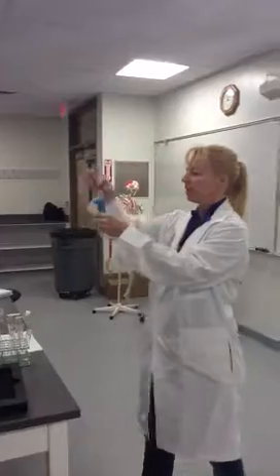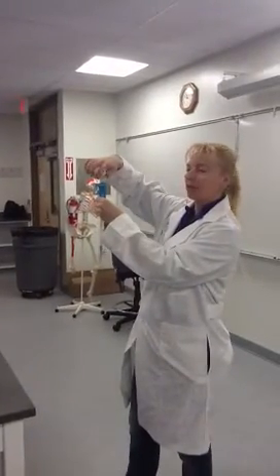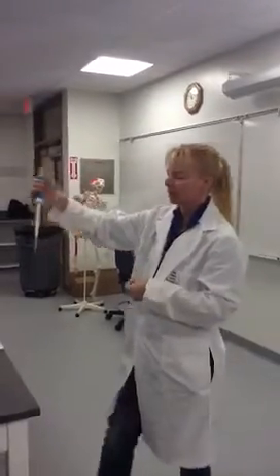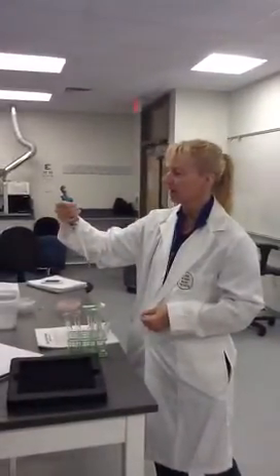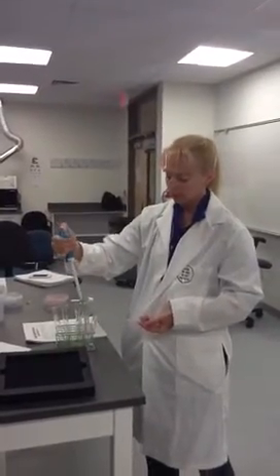The way you adjust the volume on these is at the top, and this is in microliters. And then when you press down, it's going to collect that much fluid. So right now I have this one set for 1,000 microliters, or 1 milliliter.